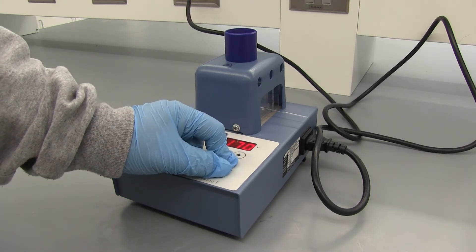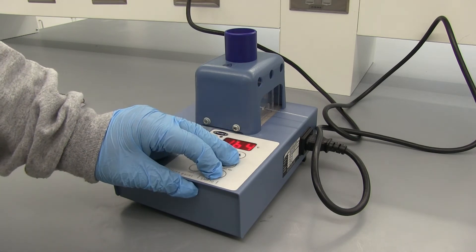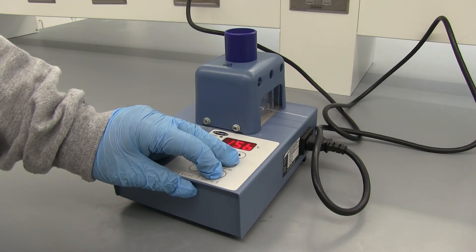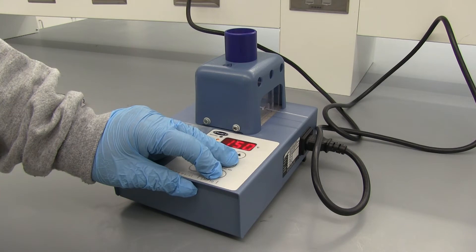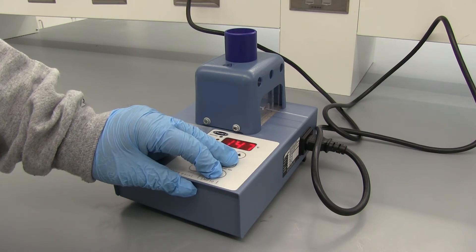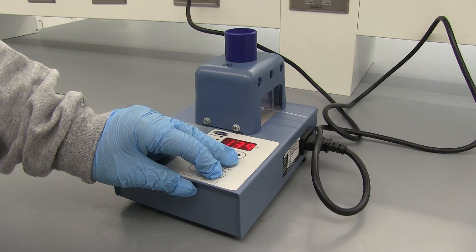So there's two possibilities at this point of this unknown. I think it's either benzoic acid or benzamide. Benzoic acid has a melting point of 123 degrees Celsius and benzamide has a melting point of 126 degrees Celsius.